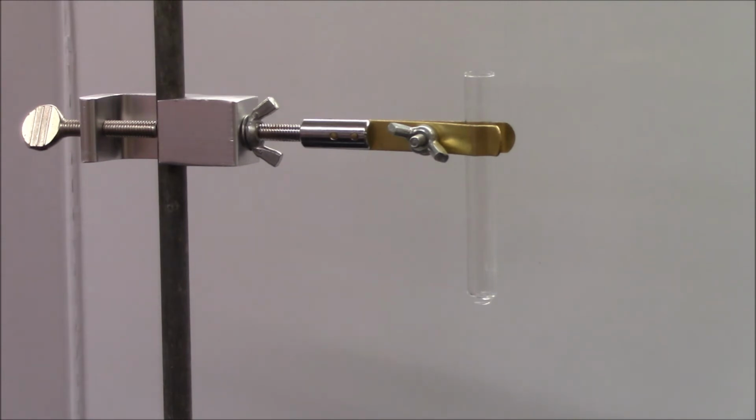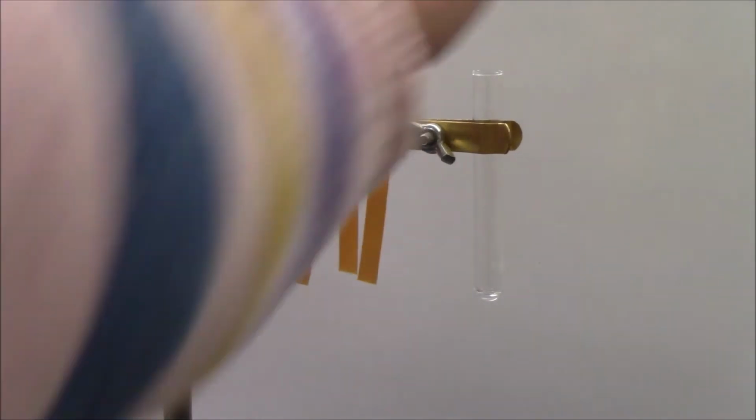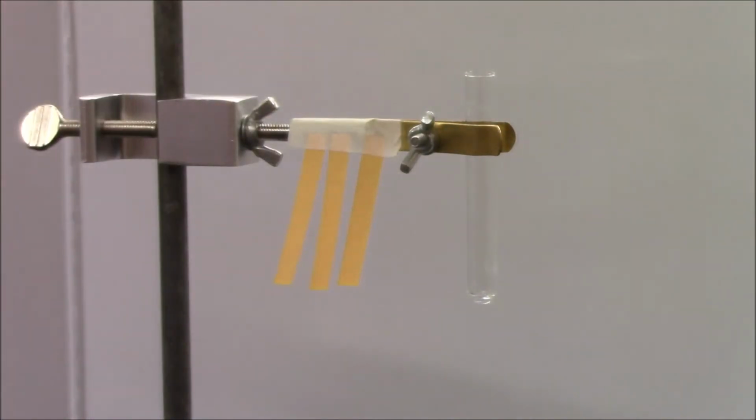Our next reaction is hydrochloric acid and sodium hydroxide. And for this reaction, I'm going to carry it out both in the test tube and using pH paper. So hydrochloric acid is an acid, obviously. And for those of you who don't know, sodium hydroxide is a base. And acids and bases have very distinct pHs. So I just need a moment to arrange my pH papers here. Let's see if this works. Okay. Here they are. I'm going to tape them up here. Here we go. You can see them.